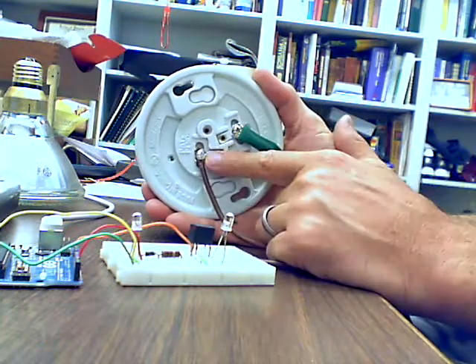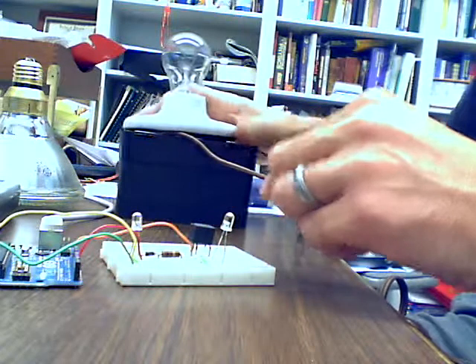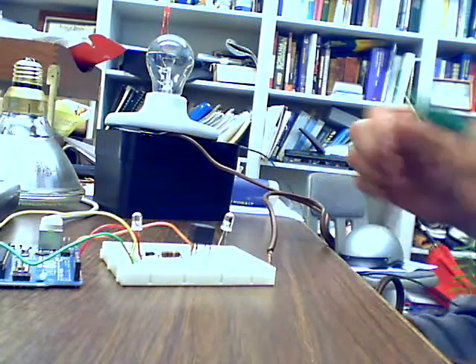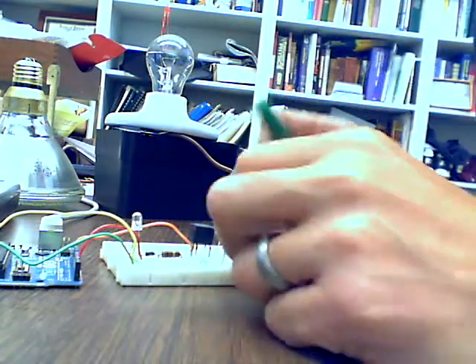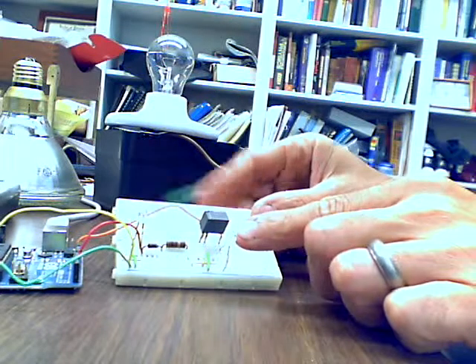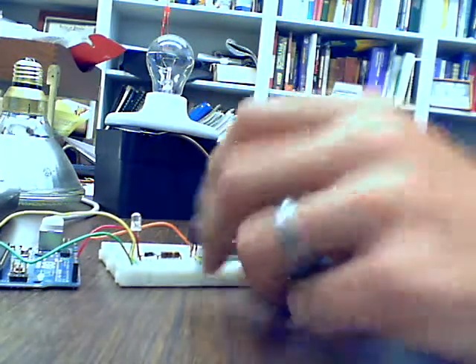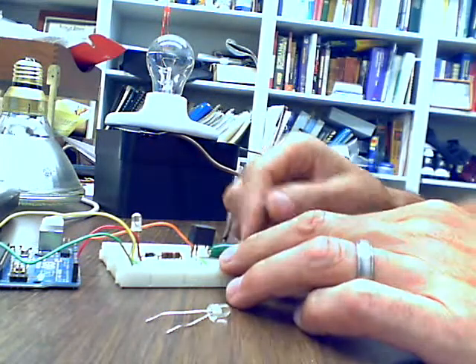Okay, so I have one end of the lamp cord and then an alligator clip. I'm going to put this on a plastic box just to isolate it from my desktop. It's a wooden desktop, but just to be extra safe. Next, I'm going to take the green alligator clip that I put onto the light. I'm going to take this LED out, and the side of it that is going to row 11 on the breadboard, I'm going to connect this green wire there. So I'm thinking of that as my ground wire.